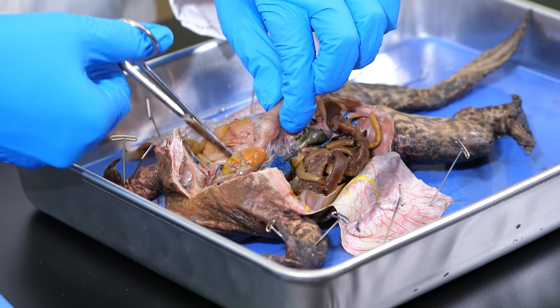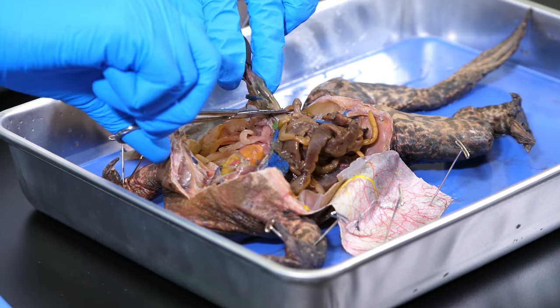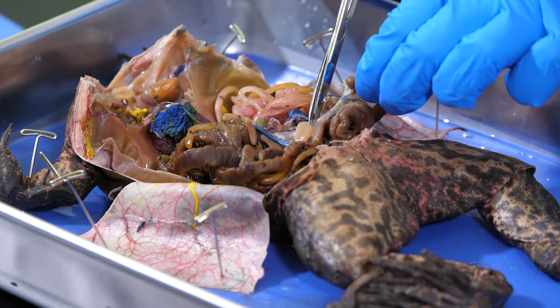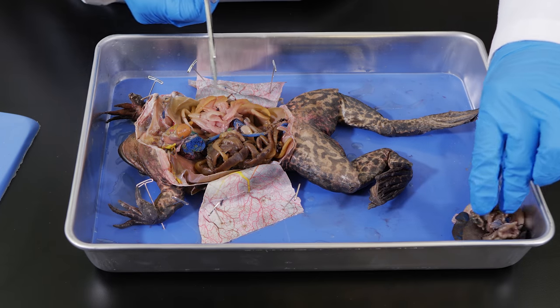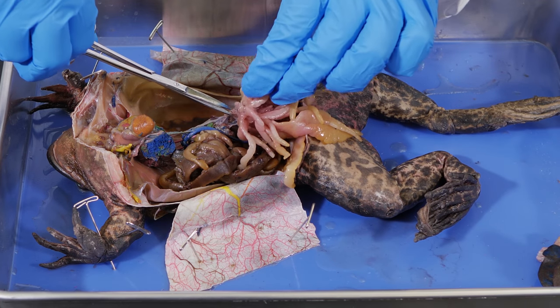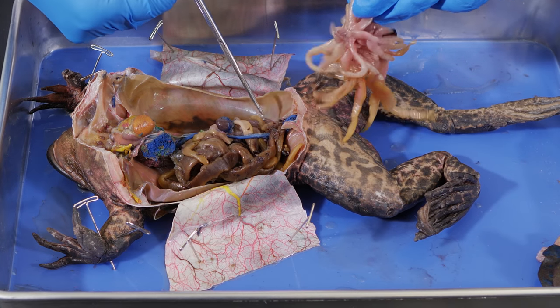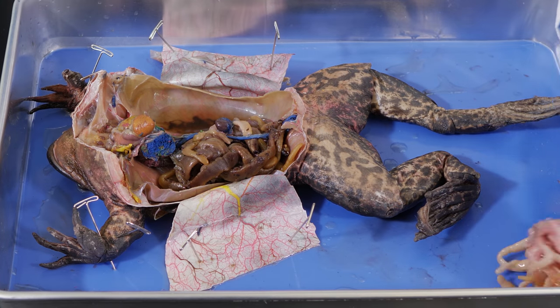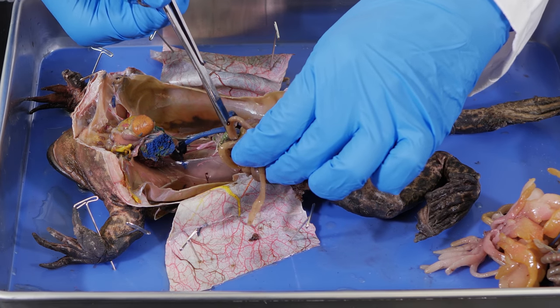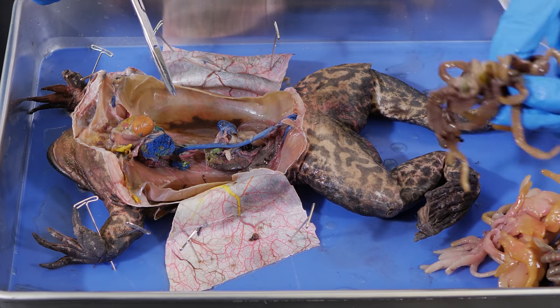Now, we will remove the stomach and the small intestines. Next, we need to remove the stringy fibers that we see through the body cavity. They are called fat bodies. Fat bodies are accumulations of fatty tissue the frog uses to store energy before hibernation during a cold winter, or estivation during a hot, dry summer.